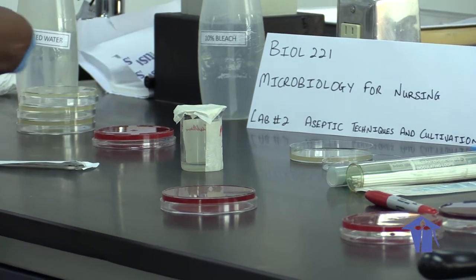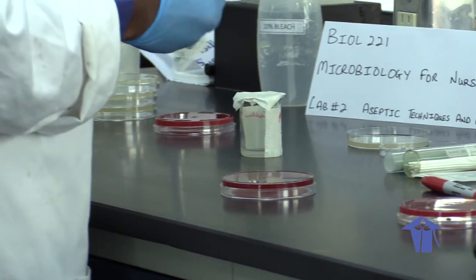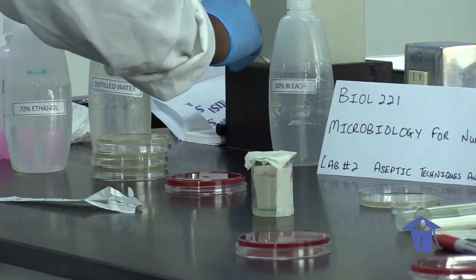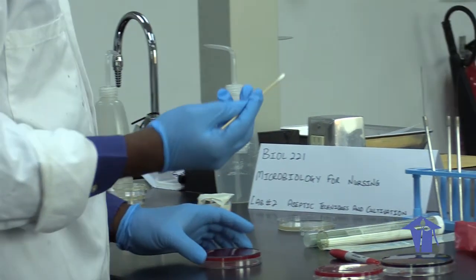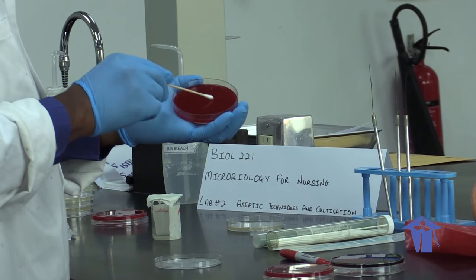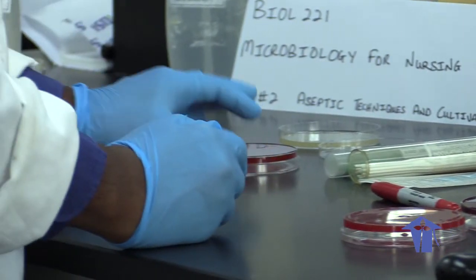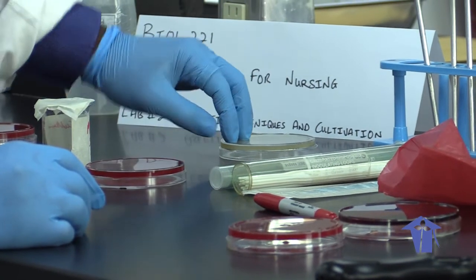On the other half of that plate, I'm going to put a swab. This is a sterile swab — I'm going to take this swab and spread the microbes over that half of the plate. Then you discard the swab in a biohazard container. Close back the environment plate after about two minutes and we'll see what grows there.